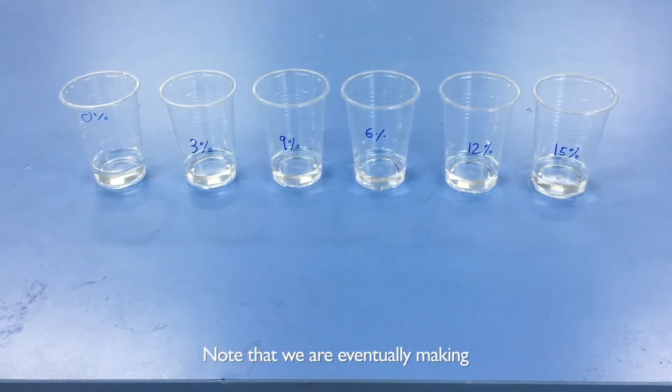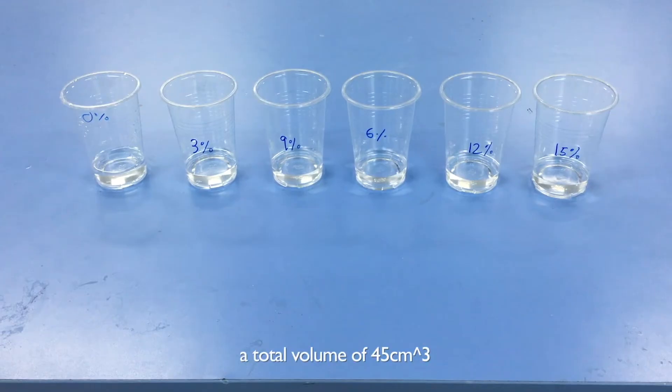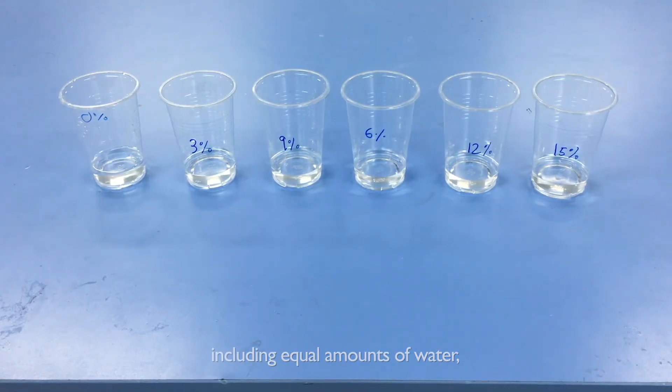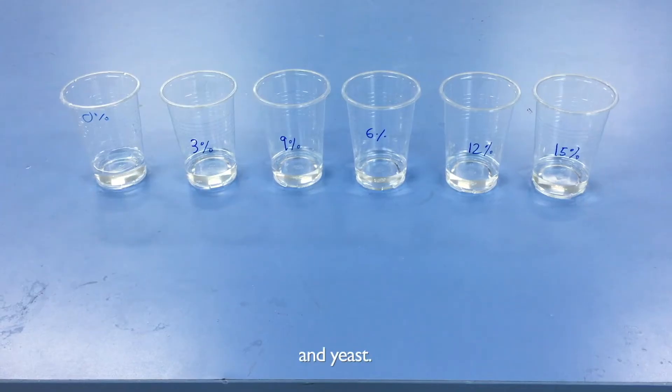Note that we are eventually making a total volume of 45 cubic centimeters, including equal amounts of water, sucrose solution, and yeast.